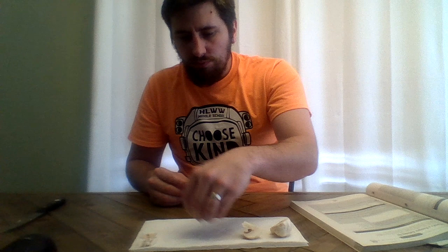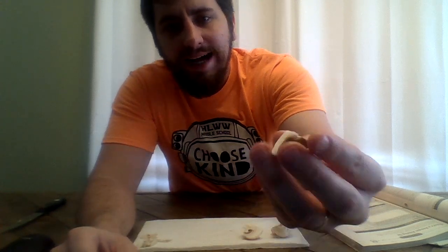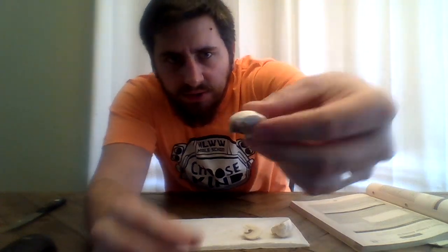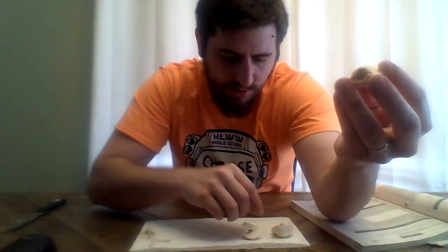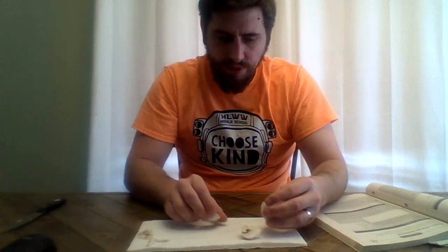So I've peeled it away, and now you can see the classic gills, right? So remember the mushroom here, like this. Okay, just part of the cap. Took away the stem, and I peeled back a little bit of the cap to see those classic gills. Okay.